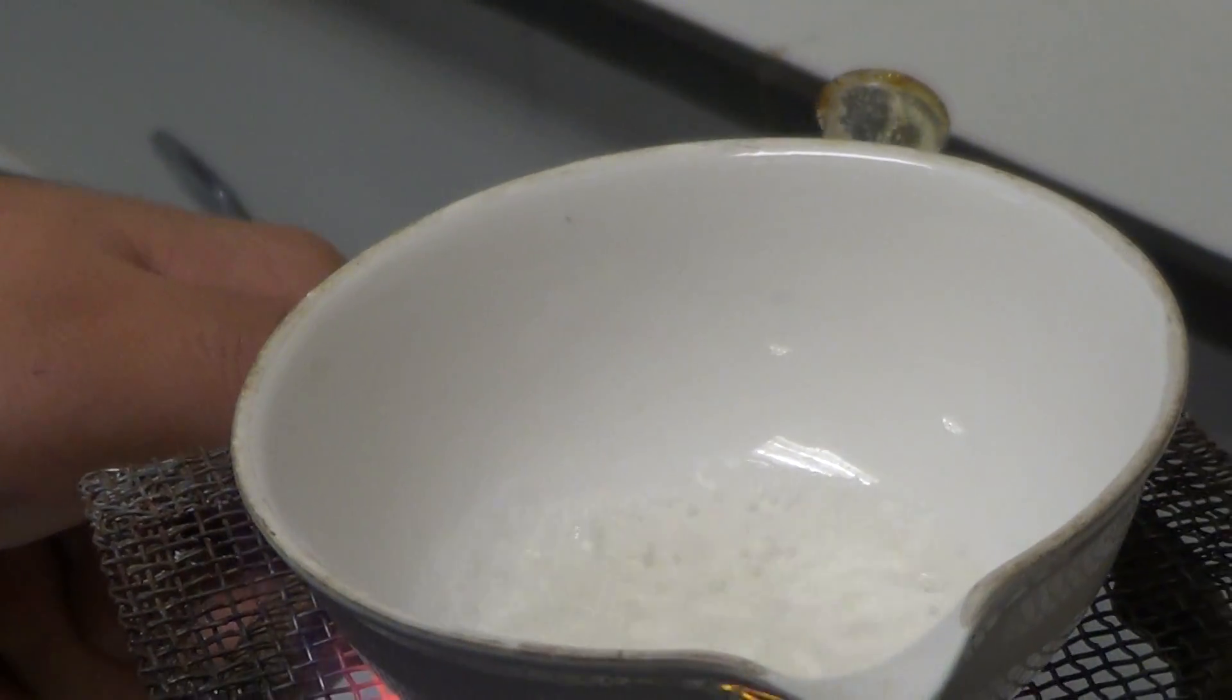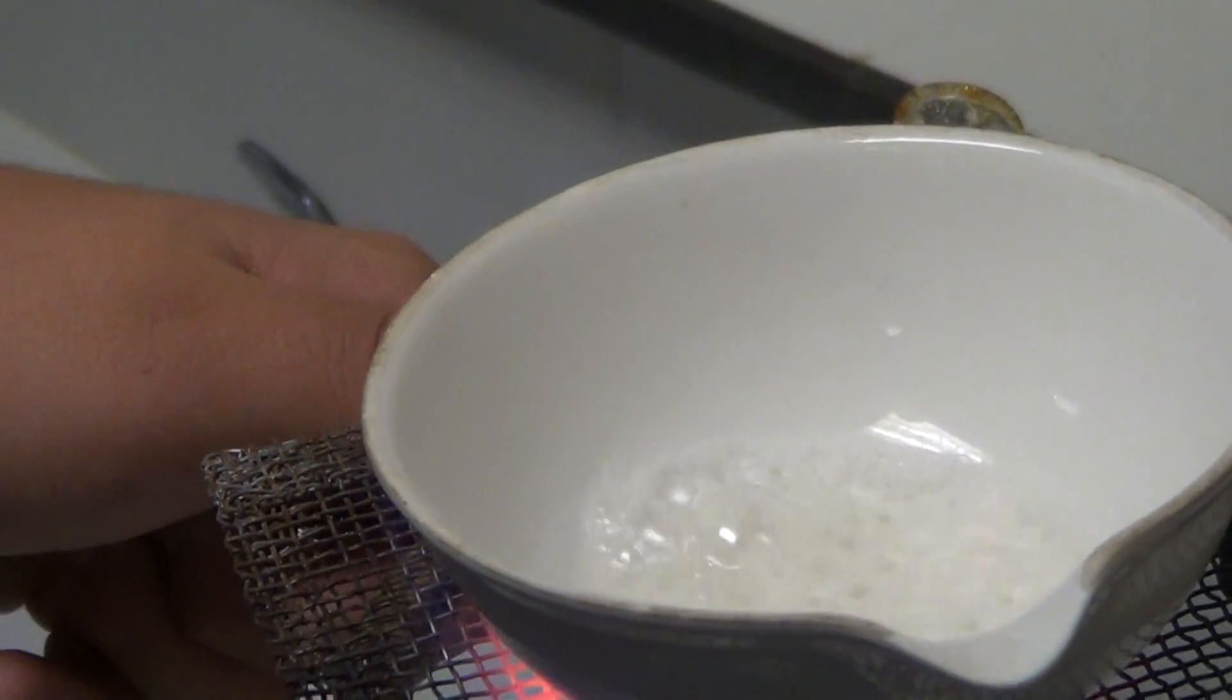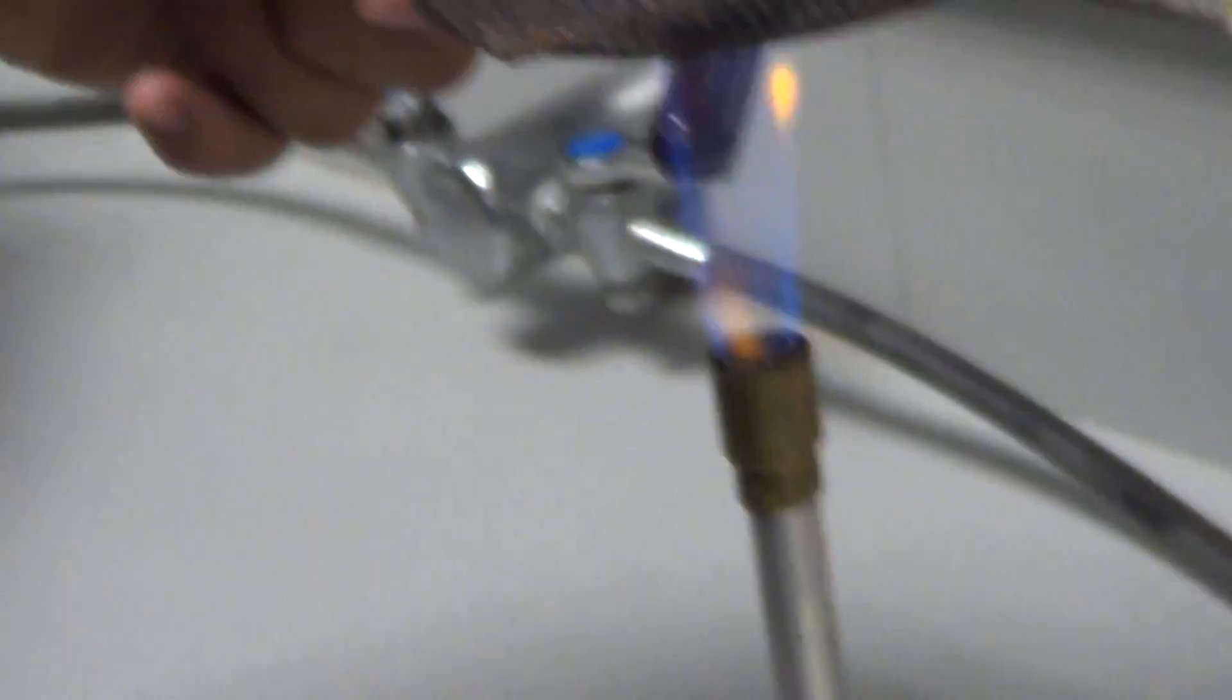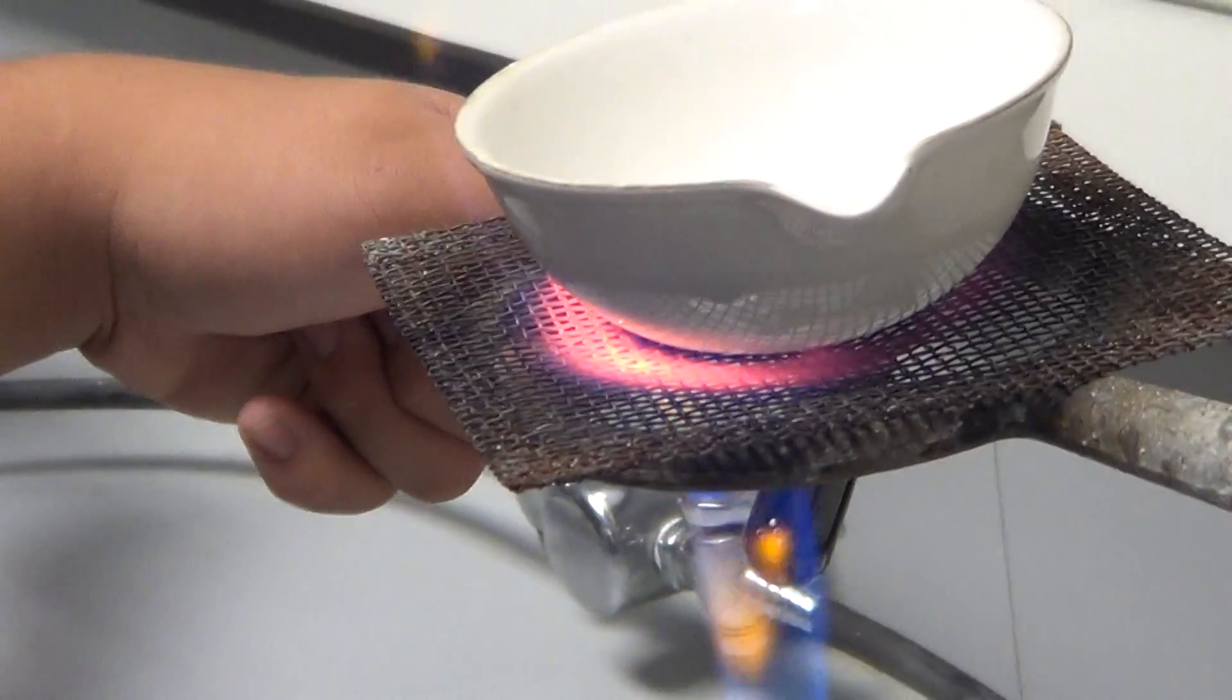I'm scared. I'm scared, Robert, because the flame is right here. I'm gonna back up a little bit. It doesn't seem too safe.